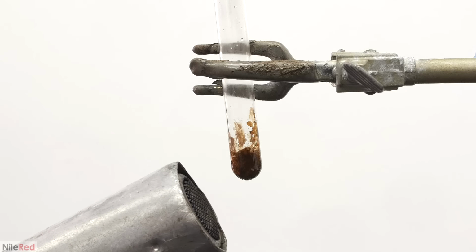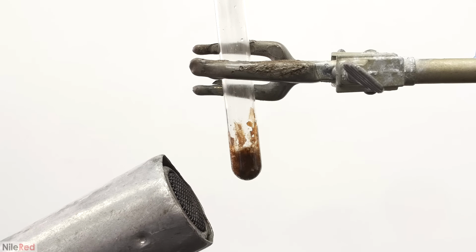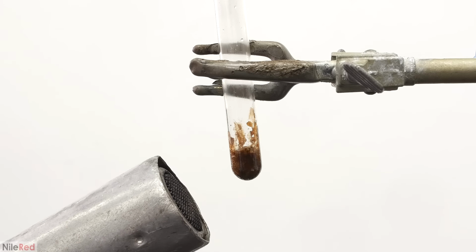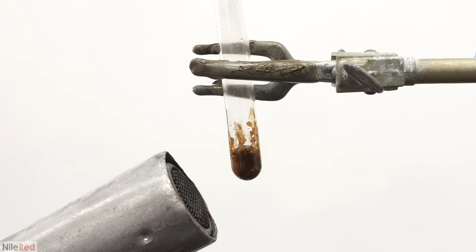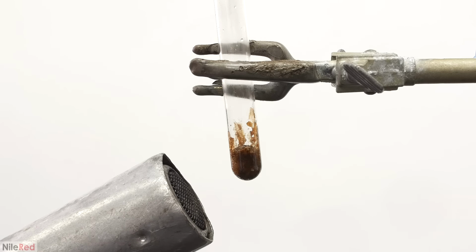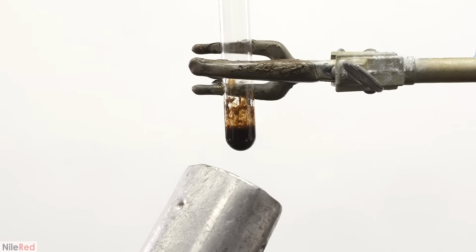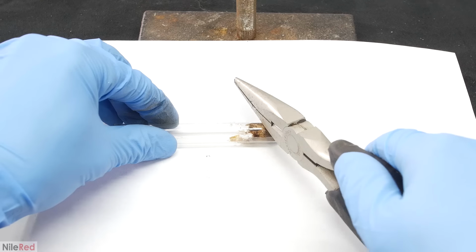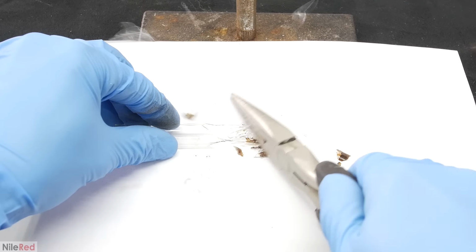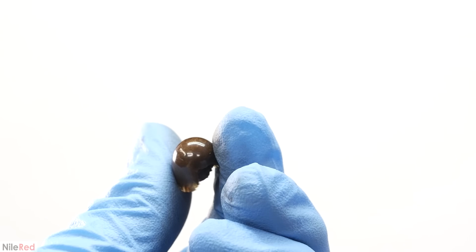Once I got to the last little bit, I continued heating it until it completely liquefied. You'll notice here that there's some bubbling going on, and these are impurities that are boiling off. The major impurity is hexamethylene diamine, which boils around 205 C. The boiling eventually dies down a lot, and I decided that I was pretty much done. I allowed it to cool, and to get out the nylon, I smashed the test tube, which kind of exploded. I found the end piece that flew away, and this is the nylon that I got.